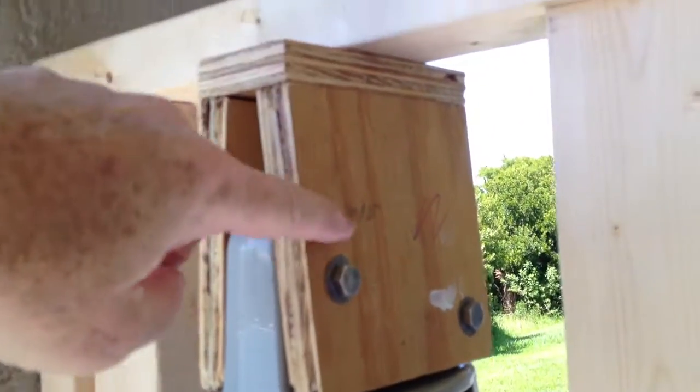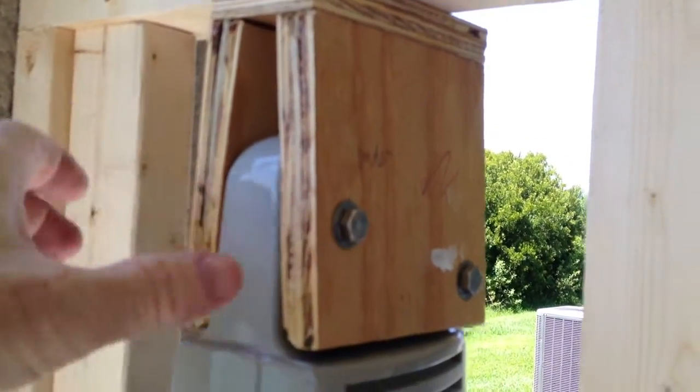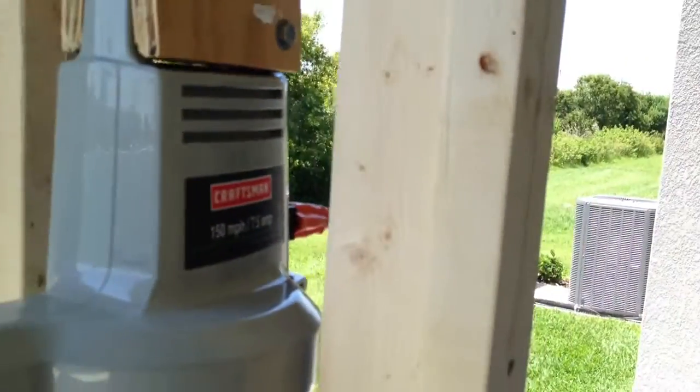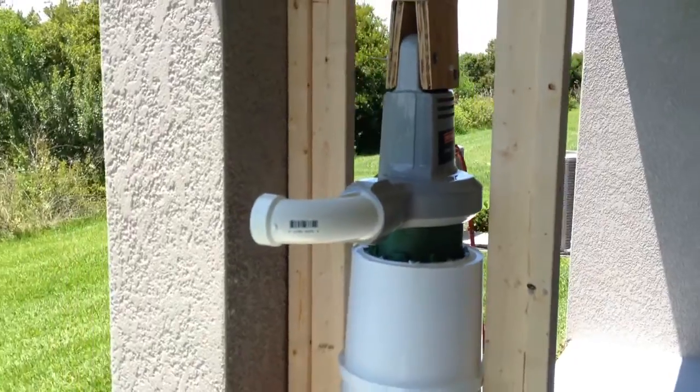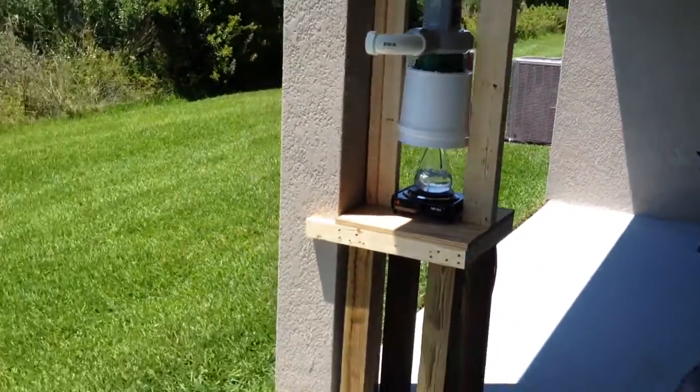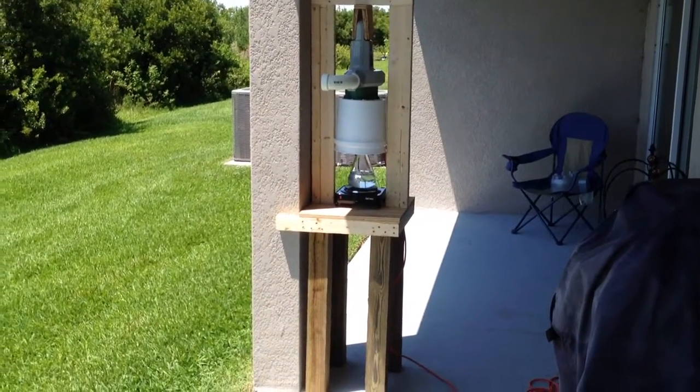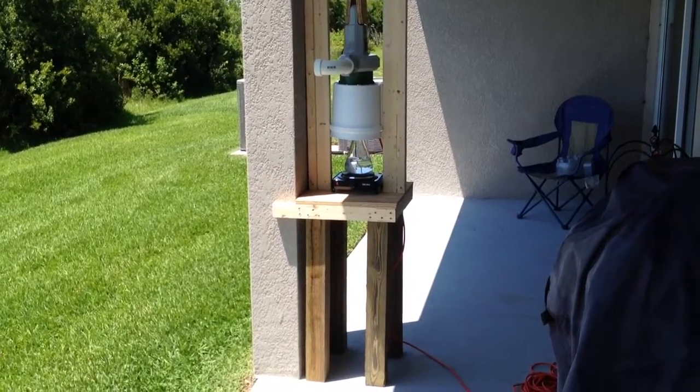I created a heavy plywood mount, put in a couple of bolts through the middle to hold it in place, and put a little brace here to lift it up above the table. I built a workbench that I can do all my chemistry in. Let me back up and see if I can get all this in there. This is on the back porch of my house.